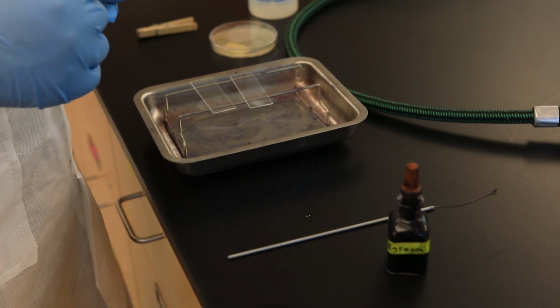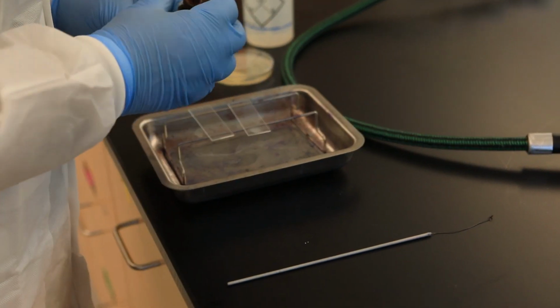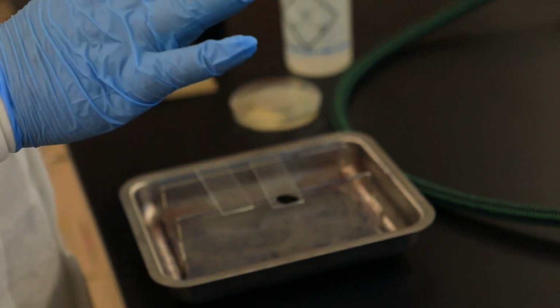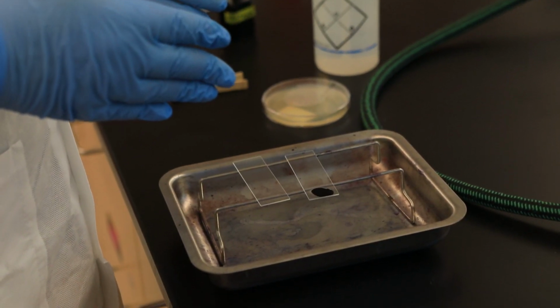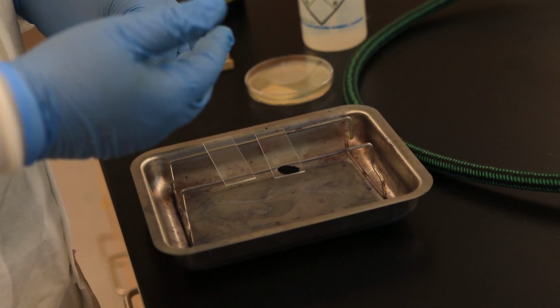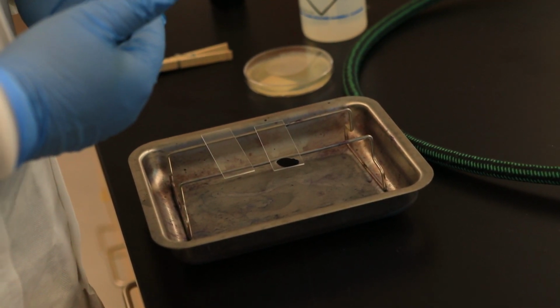Then now I can place this inoculation loop down, and now I'm ready to add, hopefully, a small drop of nigrosin. Okay, so right here, perfect, right onto the mixture. So you cannot do it in the wrong order. You can't just add nigrosin, then the water and the bacteria, because if you do it that way, you won't know if you collected enough bacterial cells.